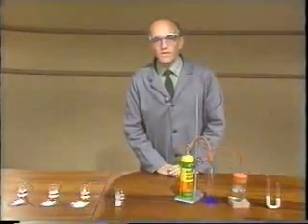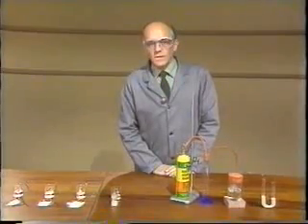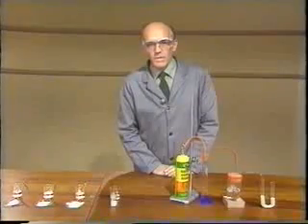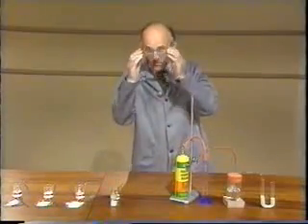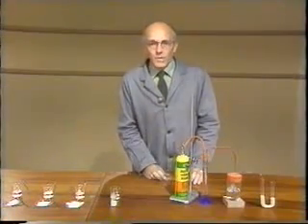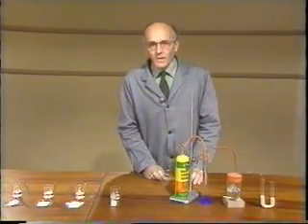Do you think that chlorine monoxide and sodium oxide will dissolve in hexane? Well, I hope from the results of all these experiments you should have learnt a good deal about the structure and bonding in all these compounds.